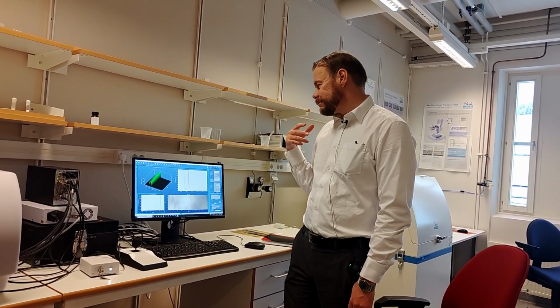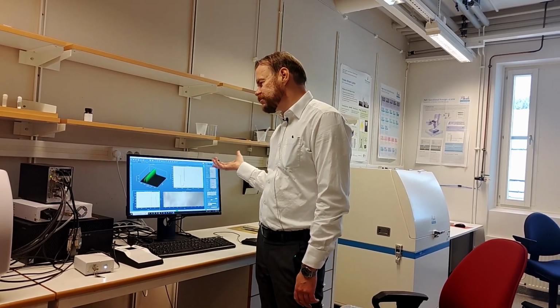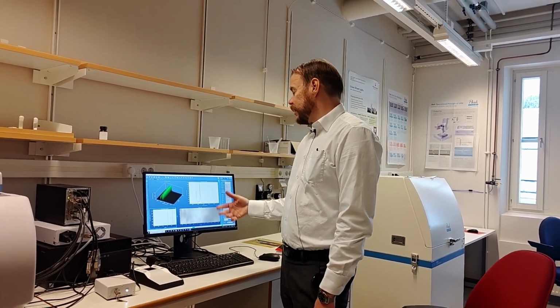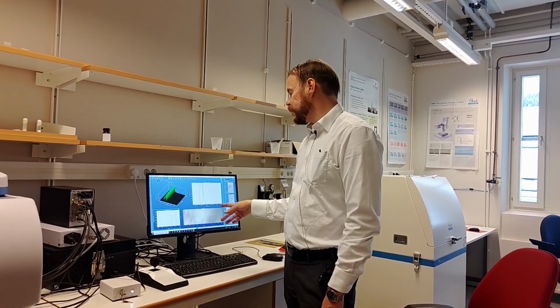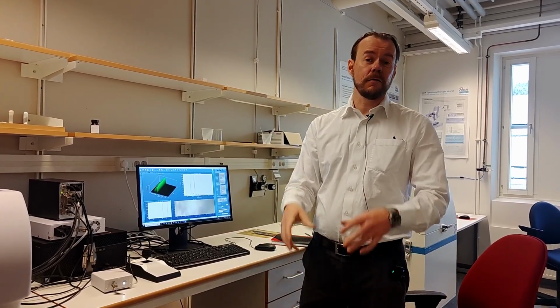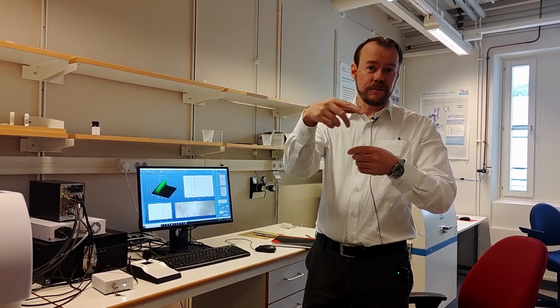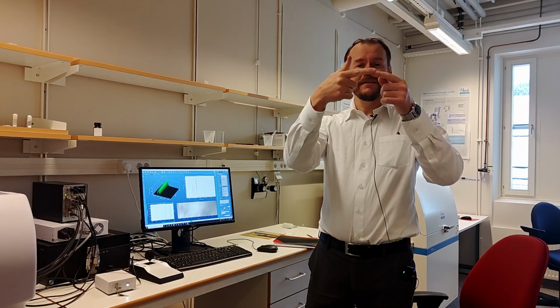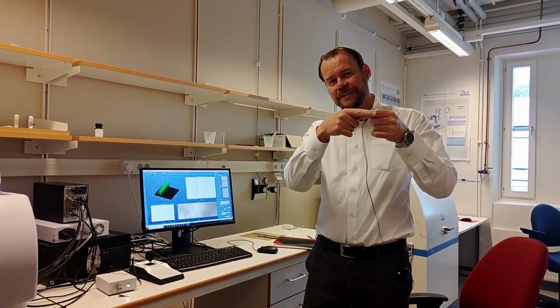So, I will say this is a quick guide on how to use the Raman microscope. And I showed the strengths of this. I mean, instead of doing one-dimensional scans like that, you can make an area if you want also, or that volume. You can scan X, Y, and Z. But if you're scanning 10 points X, 10 points Y, 10 points deep, that's 10 by 10 is 100 times 10, that's 1,000 points. It gets a lot of points.